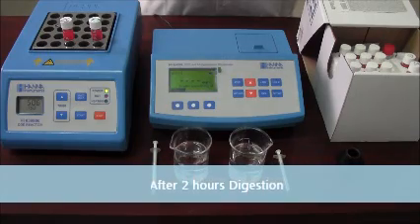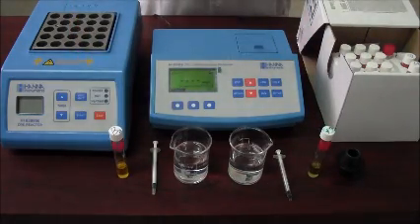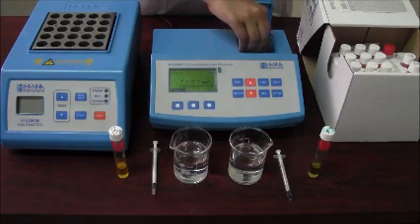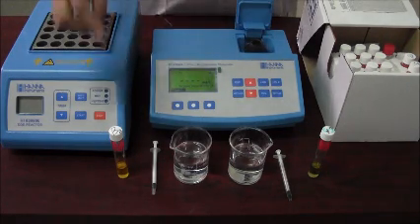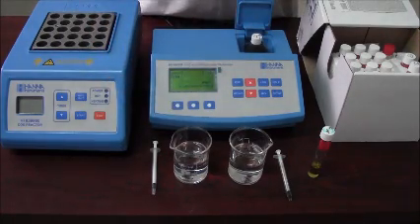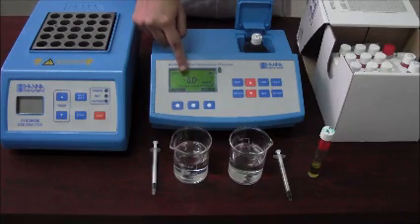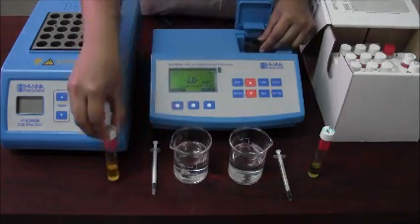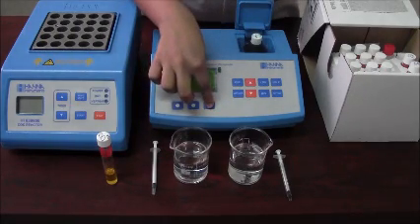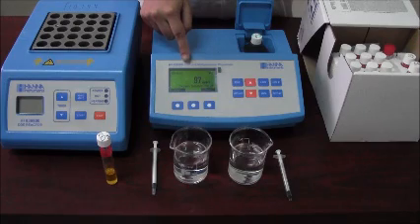After the end of the two-hour digestion period, switch off the reactor and take out both the vials and place them for cooling for approximately 20 minutes up to room temperature. Then place the vial adapter in the cuvette holder such that it perfectly fits in. Use the blank vial to zero the reading by inserting the vial into the cuvette holder and pressing the zero button. This indicates that the photometer is being zeroed. Now remove the blank vial, insert the sample vial perfectly, and press the read button. The COD content reading is indicated in mg per litre.